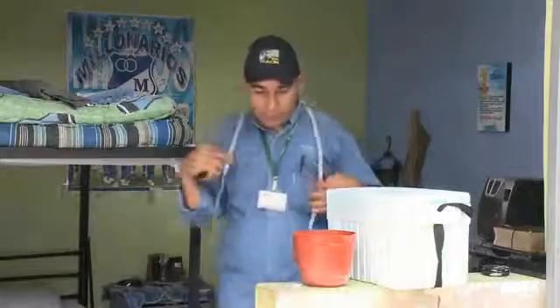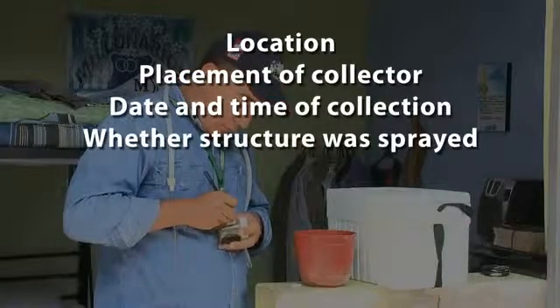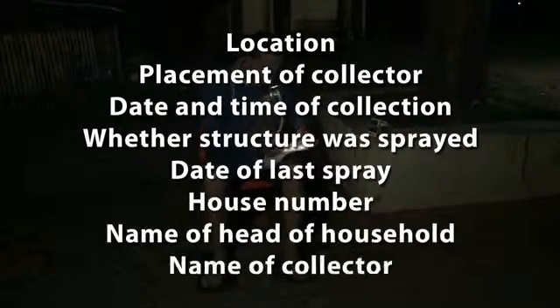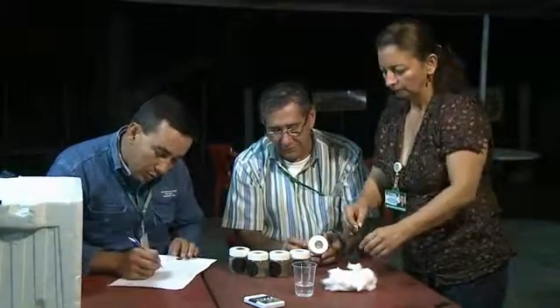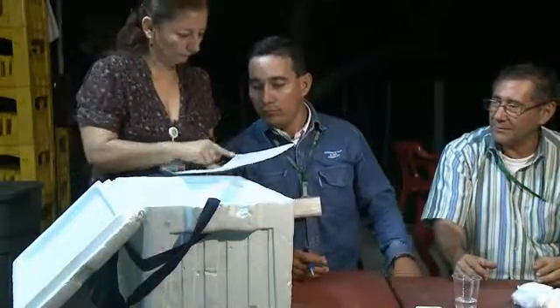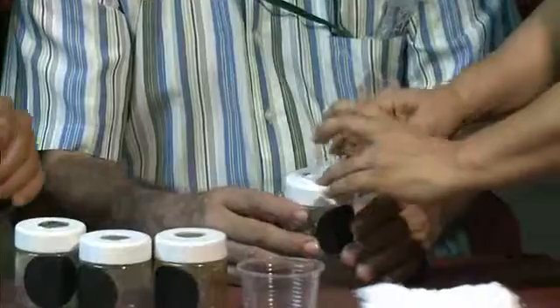Be sure that all paper cups are labeled with location, placement of collector, date and time of collection, whether the structure was sprayed, and date of last spray, house number or name of head of household, and name of collector. Use a separate cup for each house, for each hour, and for each location, indoors or outdoors, collected. As you collect, you should give each collection place a number in your notebook. Mosquitoes can be kept alive for 24 hours.